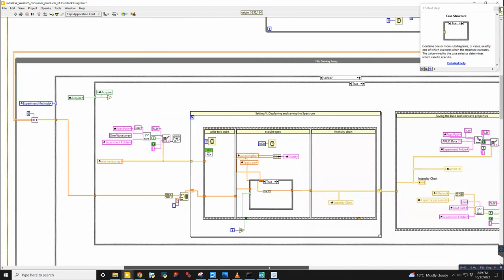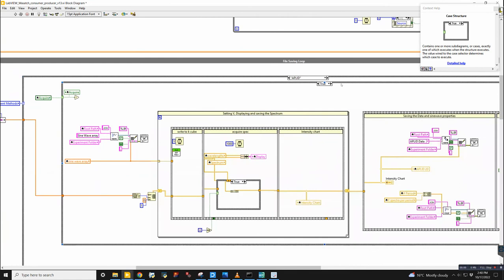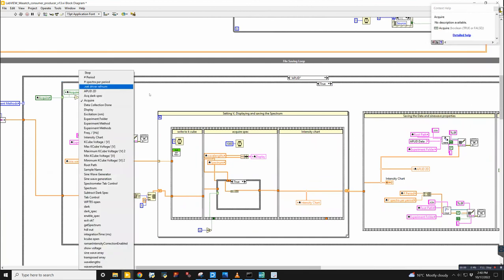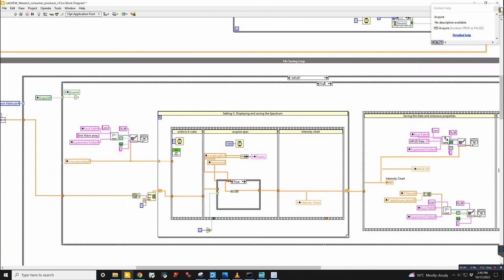Oh, I see why sometimes I'm just getting minimum. You're getting stuck in the loop there. Yeah, that's okay. That's not a tough fix to do. You have most of it, all the framework is set up. I think you just need to do a little bit of work on how the data is being passed between the loops.